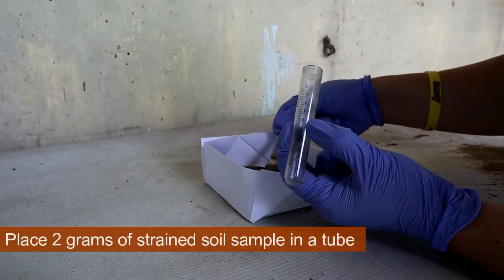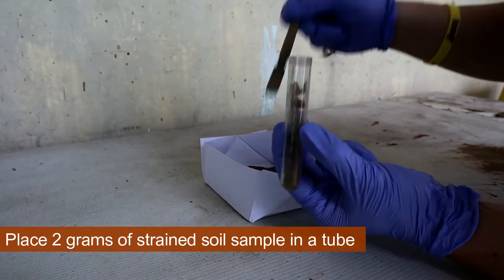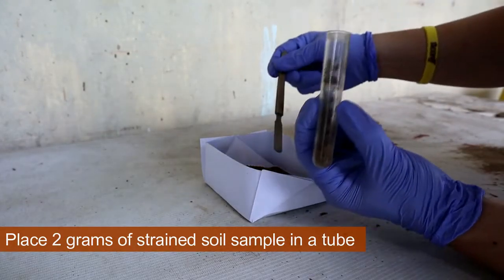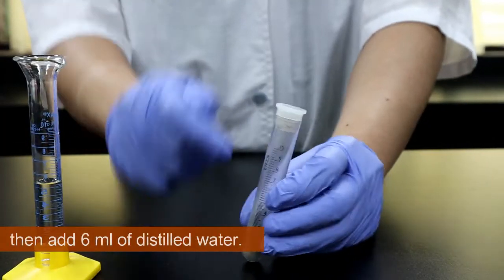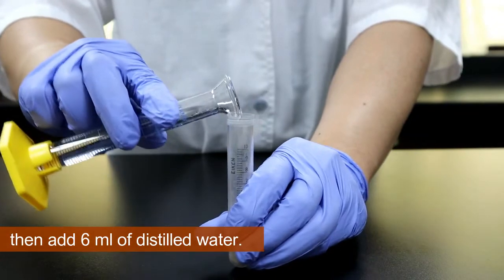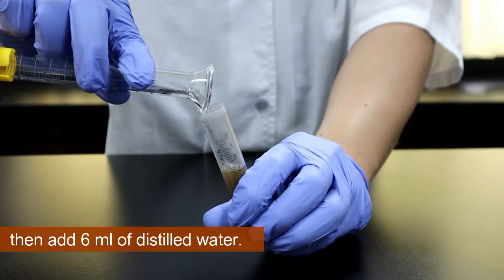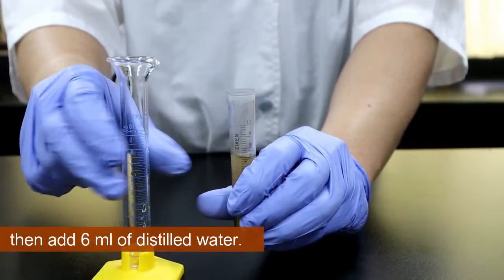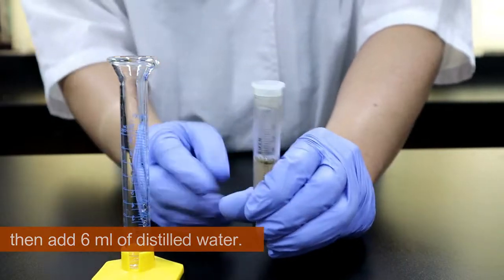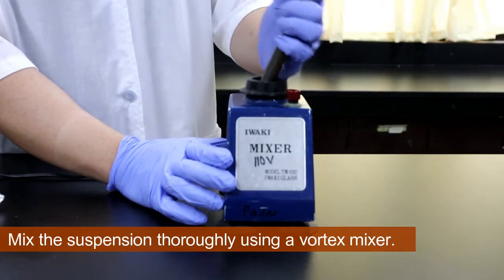Place 2 grams of strained soil sample in a tube. Then add 6 ml of distilled water. Mix the suspension thoroughly using a vortex mixer.